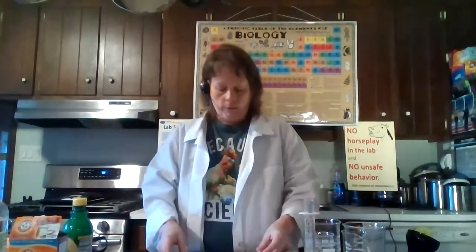Okay, ladies and gentlemen, today we're going to do the Unit 2 Chemical and Physical Changes Lab. We are here in my kitchen lab, and I'm going to do a series of demonstrations for you — little small demos — and you are going to observe and determine whether the demos I am showing you are chemical or physical changes. So there are questions embedded in the lab. Before we do any lab, as always, safety goggles on.